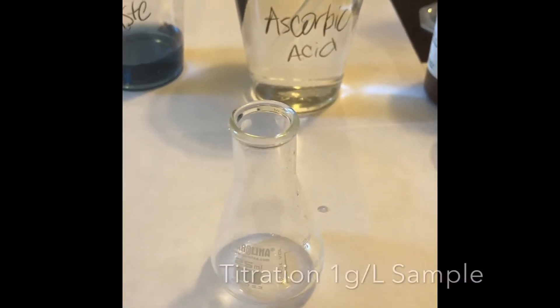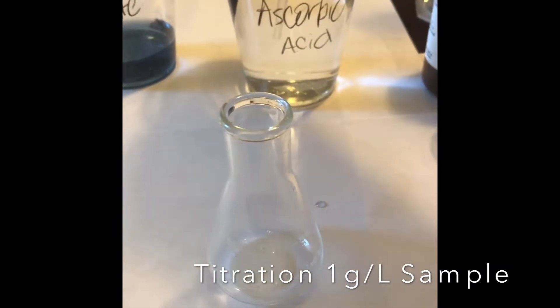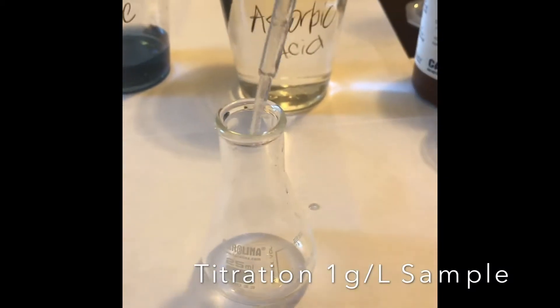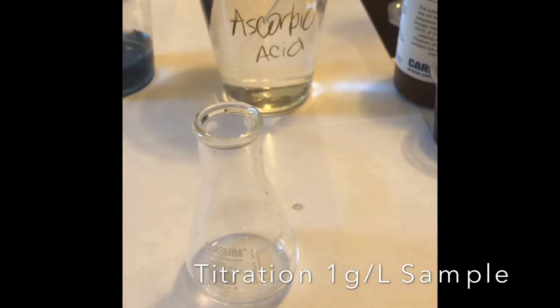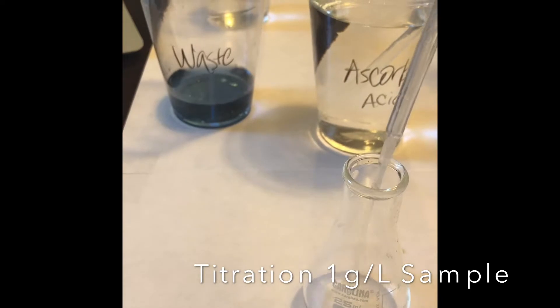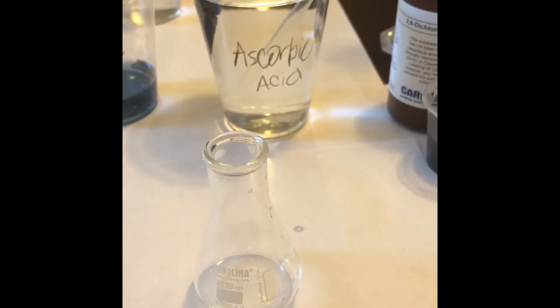We need to perform the titration for the 1 gram per liter sample. We're going to put 1 ml of the ascorbic acid into the flask and then 1 ml of pure water to the flask, then put 5 ml of the DCPIP in the syringe.